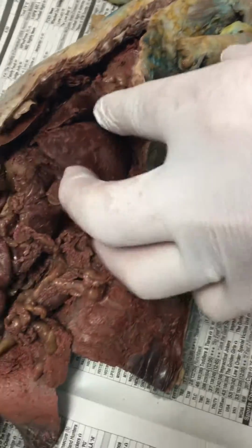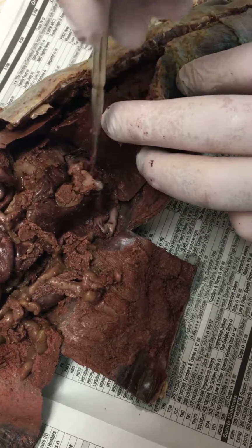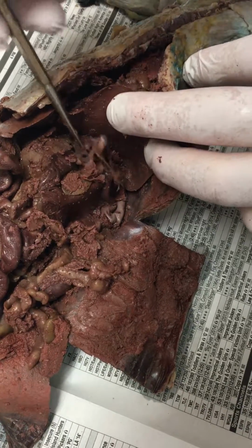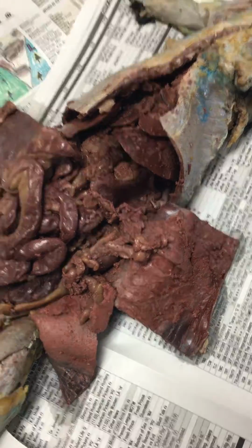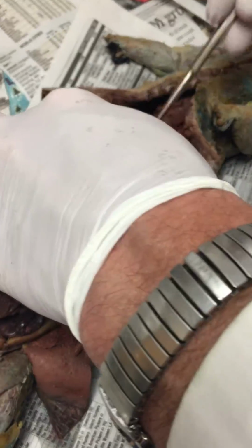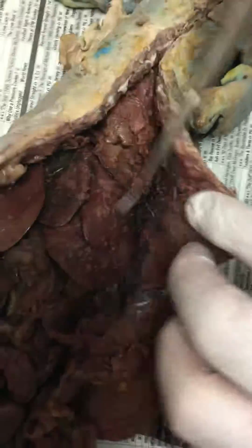The 5th part: lift the whole liver up and look underneath it. There's a little tongue of liver right in the middle of this mesentery. I'm going to dig it out of the fat right here. That little lobe of the liver is called the caudate lobe. Got the parts of the liver. So the medial is on the top and the lateral is on the bottom? Medial is in the middle. Right medial, left medial, right lateral, left lateral. Caudate lobe underneath it.